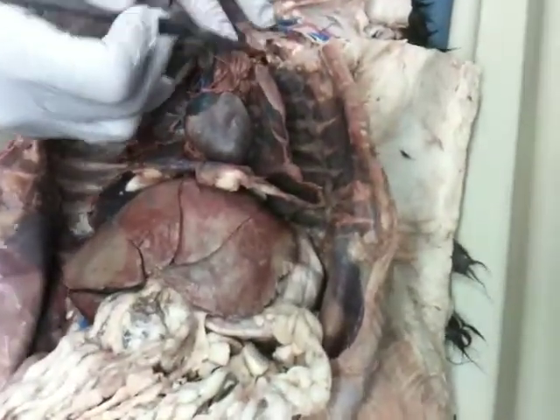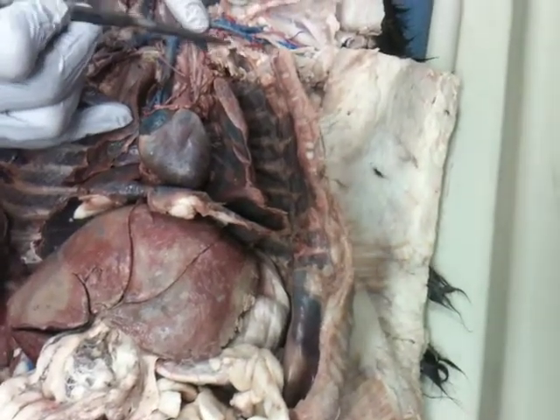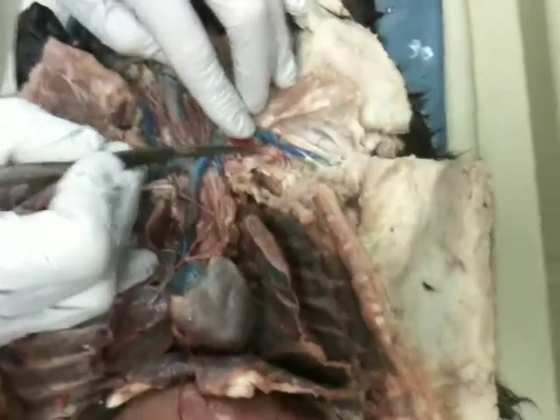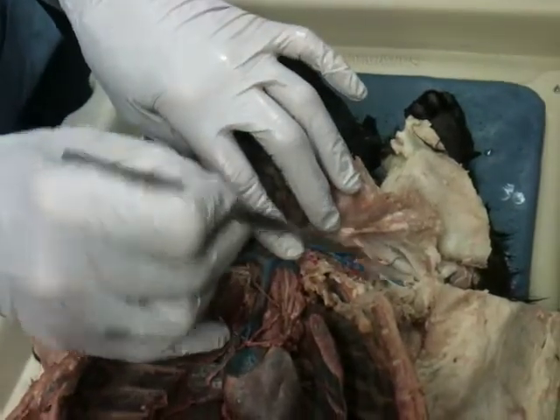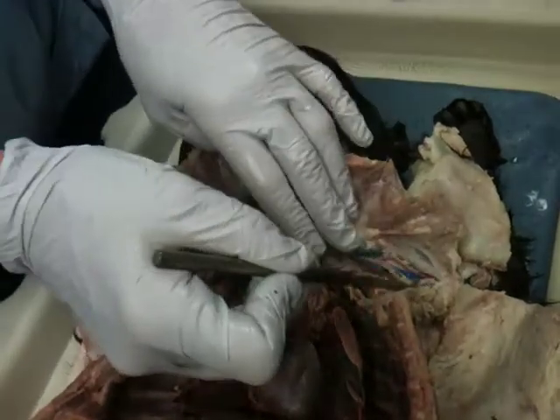I'm sorry, I was cleaning off my. Okay, over here on the left side, we had the subclavian coming along. Once it curves around the rib, which somewhere down there, I've taken that off, it becomes the axillary. Once it sends down structures, this deep one going down there, which would be the subscapular, and once the long thoracic comes off, now it's the brachial.